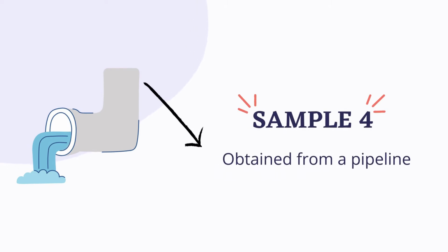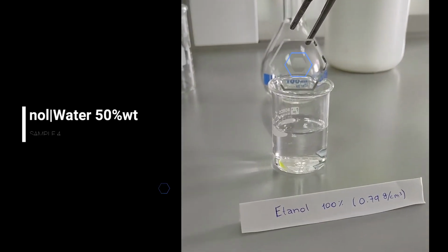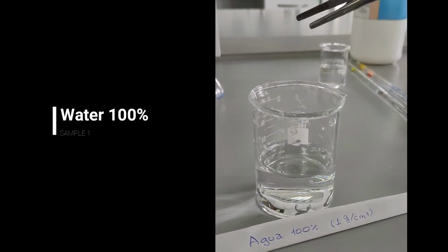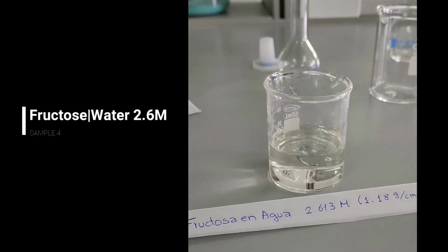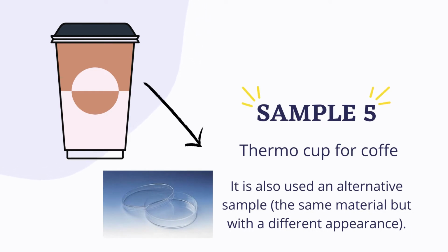The fourth sample, called sample 4, was obtained from a pipeline. The fifth sample, called sample 5, is a thermal cup usually used for coffee. Additionally, an alternative sample is used, made from the same material but with a different appearance.